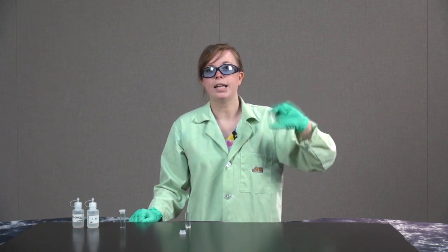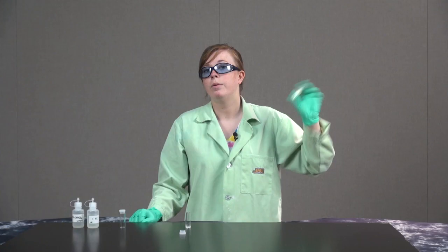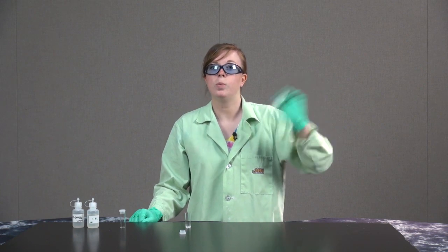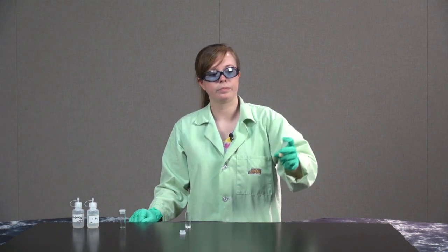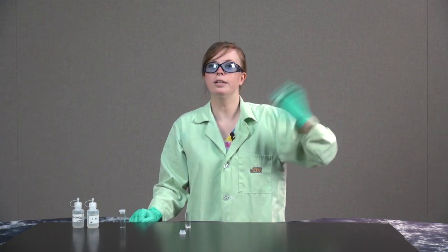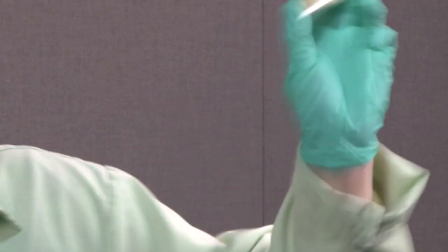Lead nitrate and potassium iodide combine to form lead iodide, which is yellow, and potassium nitrate, which is white. I'm going to shake it a little longer here to see if I can get the reaction to go a little more.